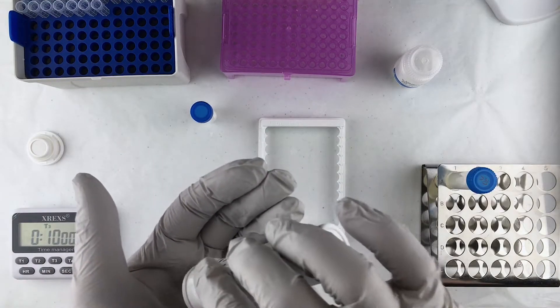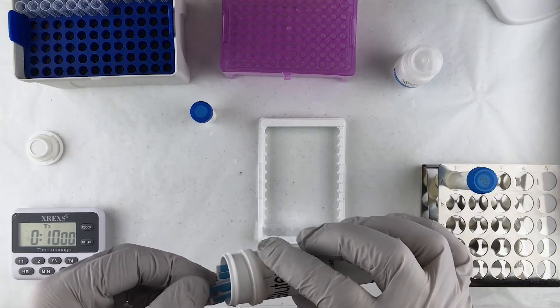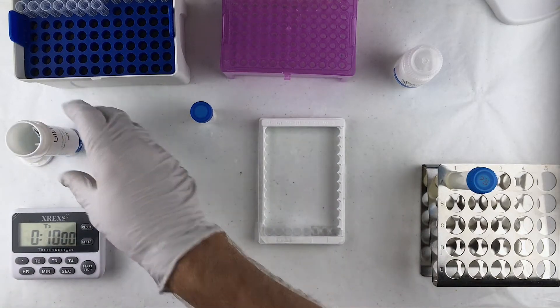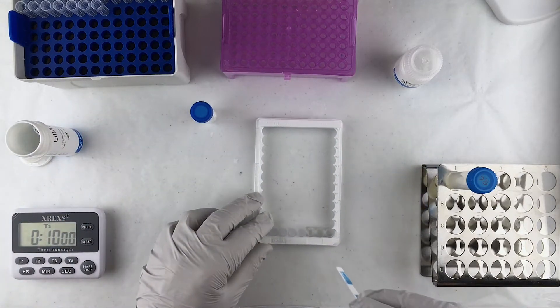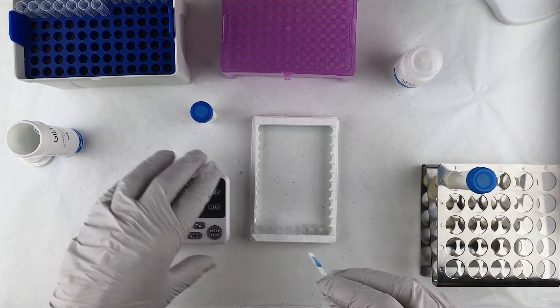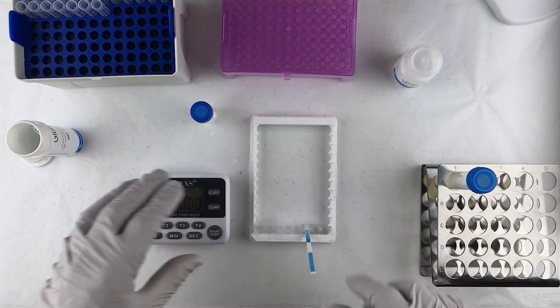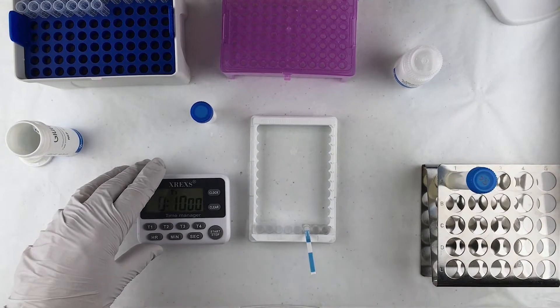Now the next step is to pull out a test strip. We'll drop it in that well. Start a timer for 10 minutes.